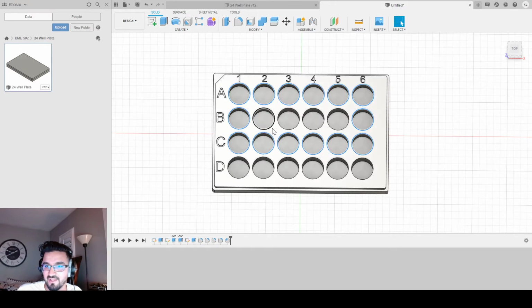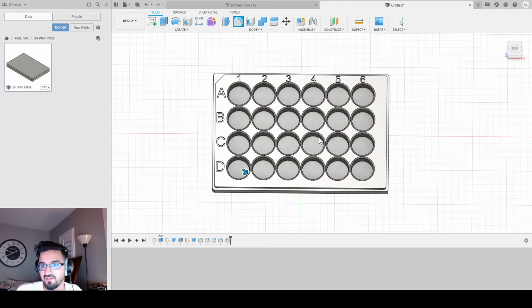If we keep going, I can't believe I forgot this entire row. Almost there. If we select each and every last one of these, right? I can now fillet them. And if I do it by 1, might be too much. Let's go 0.7. Yeah, 0.7 is perfect.